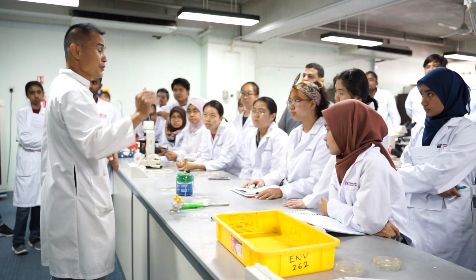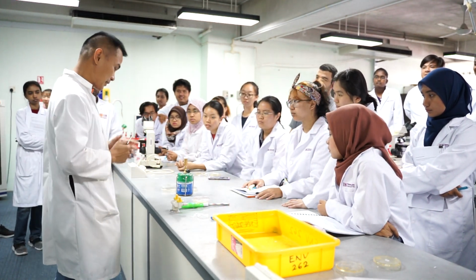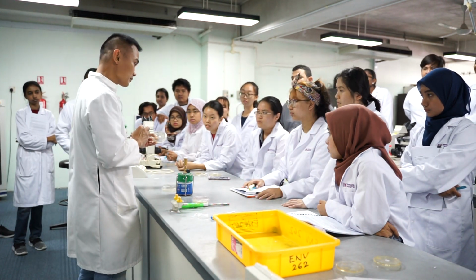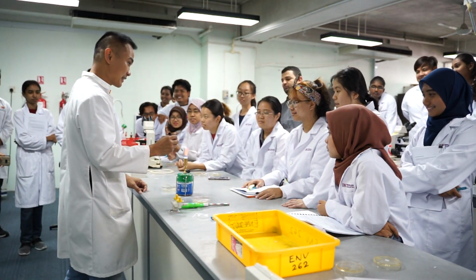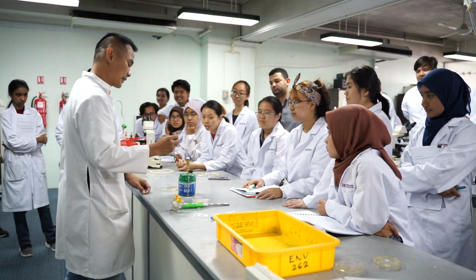If we have laminar flow, you can also use laminar flow. But if you don't have, according to standard procedure, this flame alone is enough. Okay? And then you see, I'm gonna isolate the yellow ones. Look at that yellow one. So the first thing is you're gonna burn this, because this is going to kill all of your bacteria, yeah.